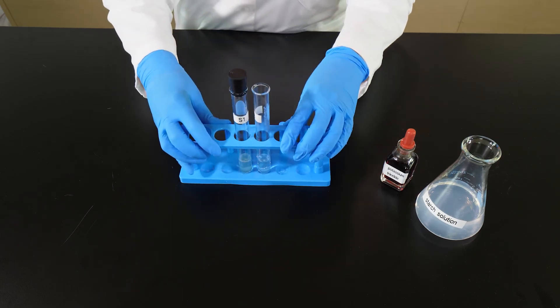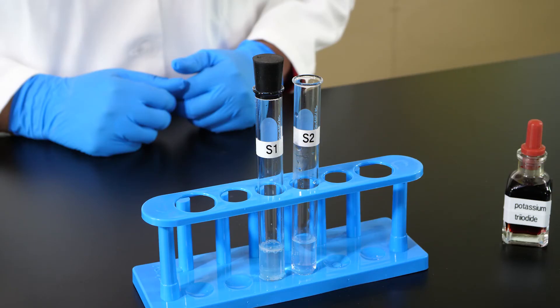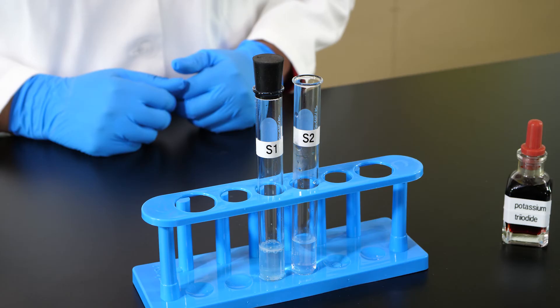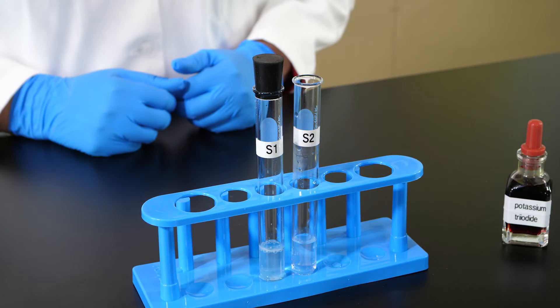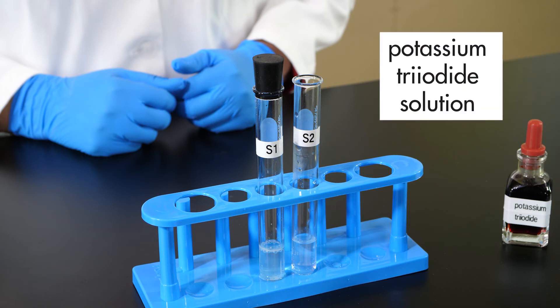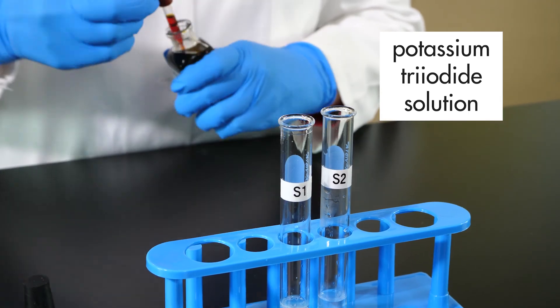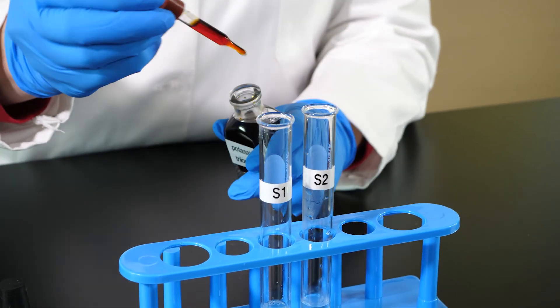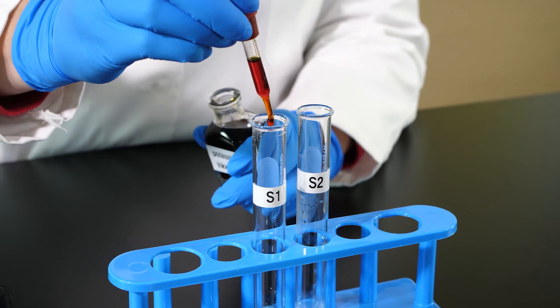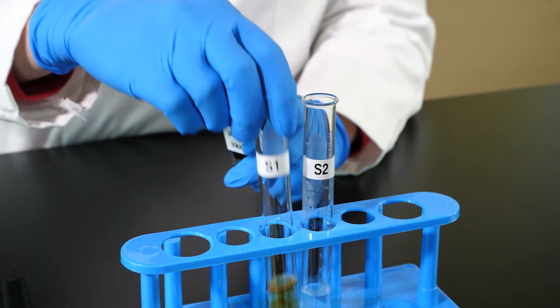It is time to remove both test tubes from the water bath. Now we are ready to check each test tube for the presence of starch. If starch is present in a solution, it means starch digestion did not take place. The chemical indicator for this test is potassium triiodide solution, which turns black in the presence of starch. We add 3 drops of potassium triiodide solution to each test tube and mix the contents.